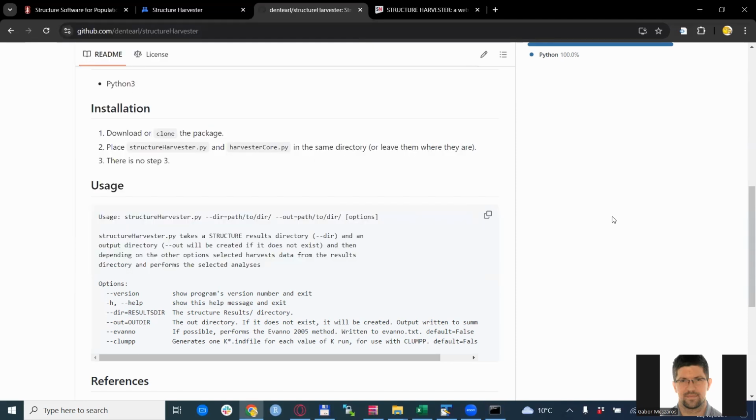The use of the structure harvester Python script is fairly simple. We write python to start Python, then structureharvester.py is the script we want to use. It has a few options to consider. The first thing is --dir=, and it should be the results directory from your structure run. You need to put the full path there. The second thing to add is --out=, which is the output directory, where the results of the structure harvester will go.